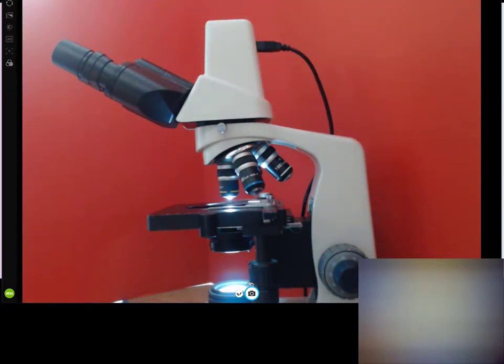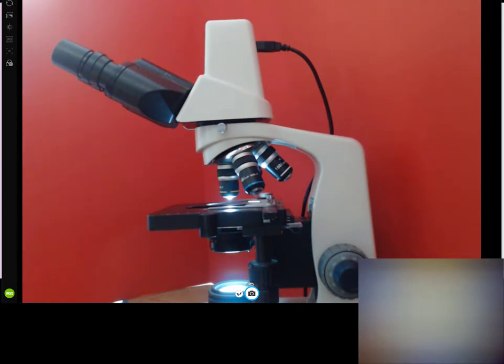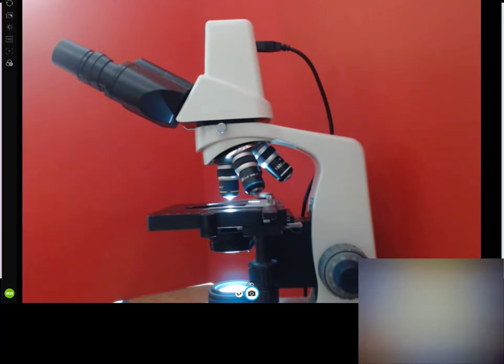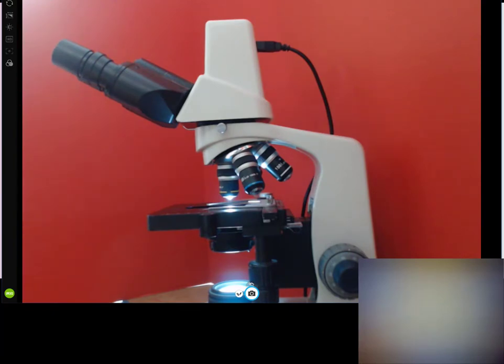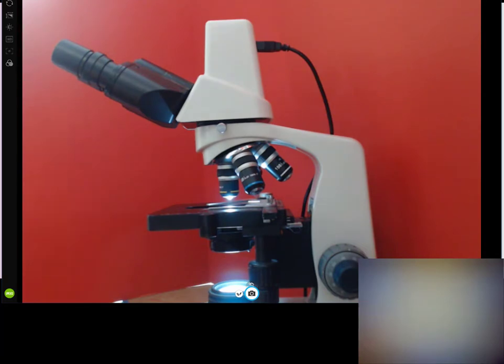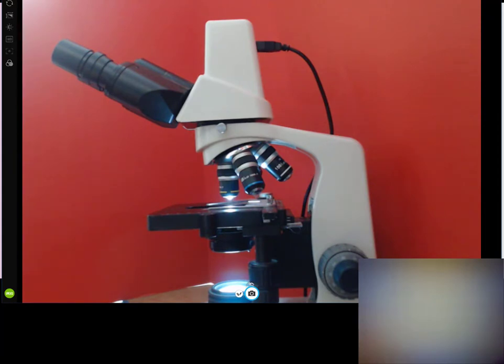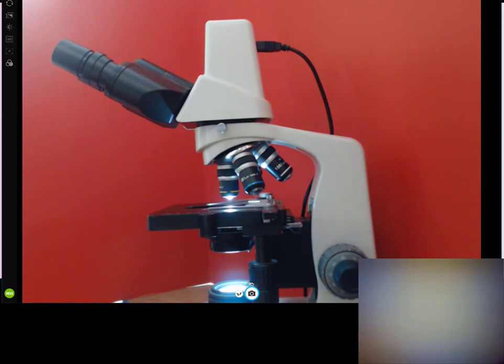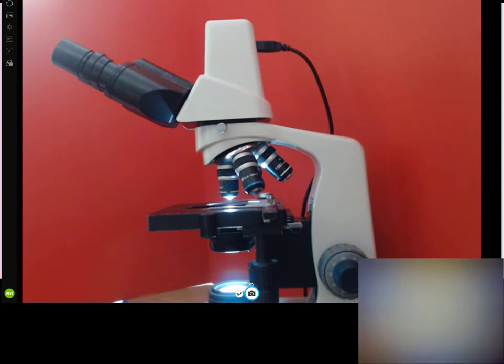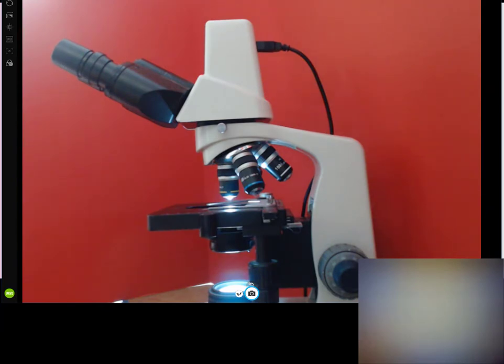I do have a camera on here, and hopefully that's picking up everything going through the viewfinder, so you'll be able to see both the microscope and what's on the viewfinder on the screen concurrently. You can kind of see what I'm doing and what the effects are — that's the best I can do to give you that feel for how the microscope works.